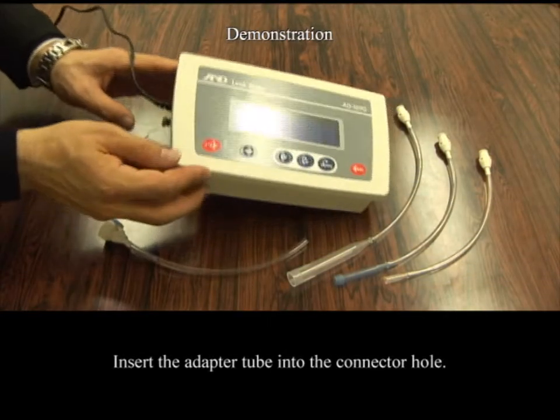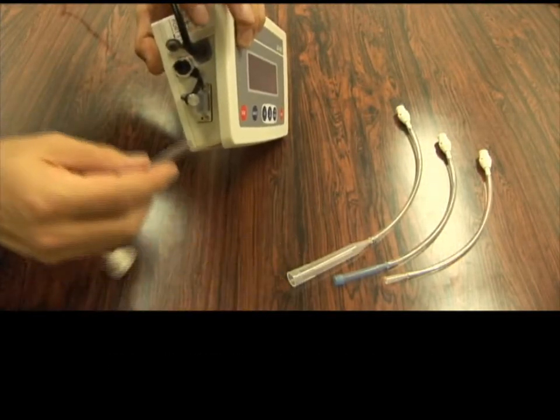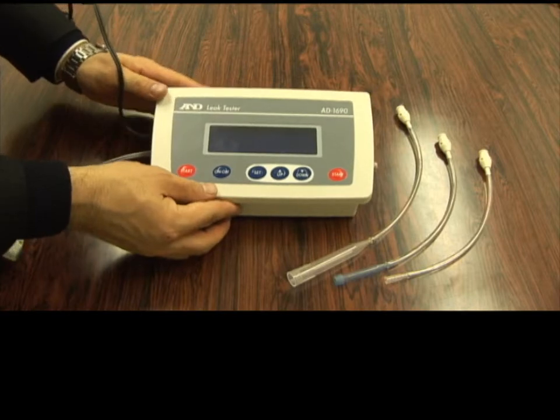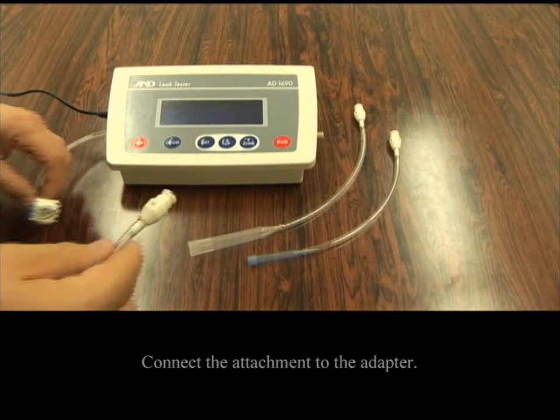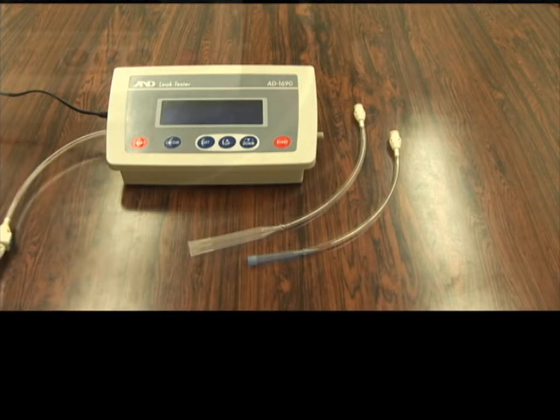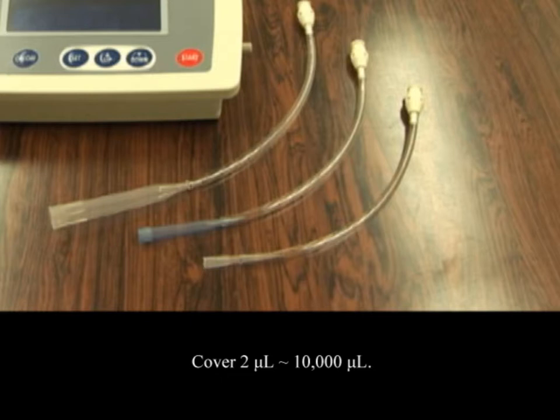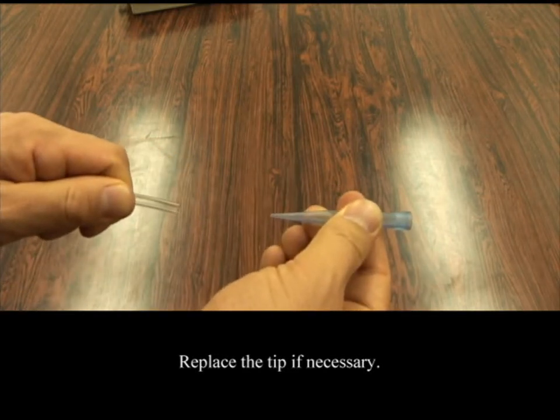First, remove the air plug and insert the adapter tube firmly into the connector hole. Next, select the attachment with the tip that matches the size of the pipette and then connect the attachment to the adapter. The AD1690 includes three types of attachments to cover pipette capacities ranging from 2 microliters to 10,000 microliters. If your pipette does not match up with any of the attachments provided, replace the tip of the attachment with a tip that matches the pipette.